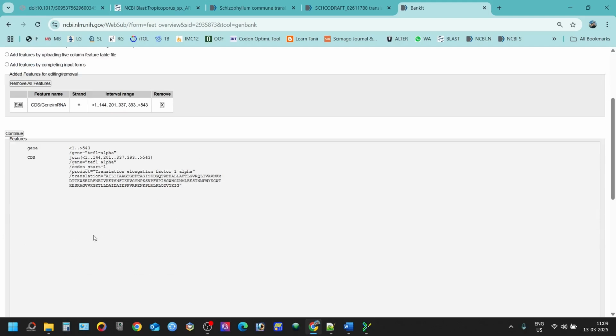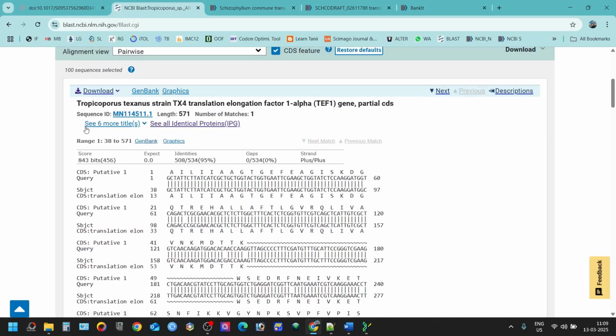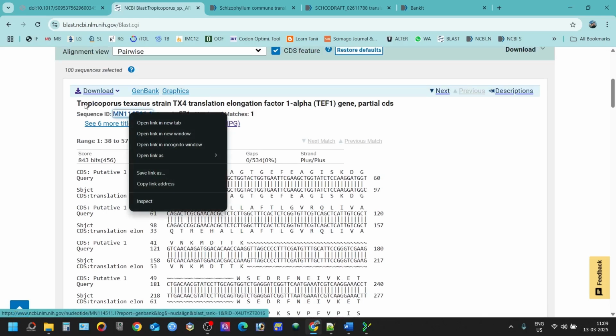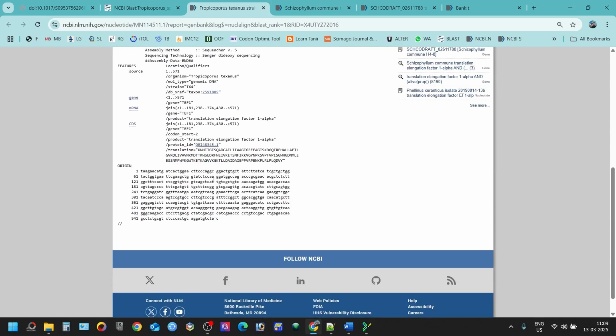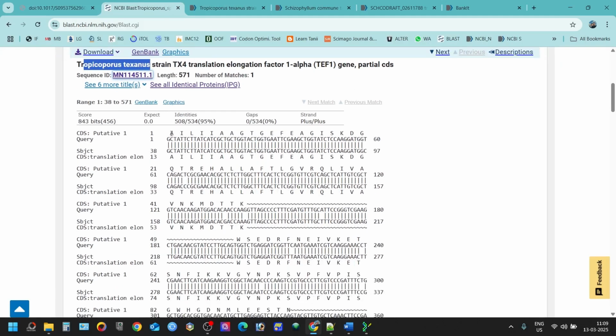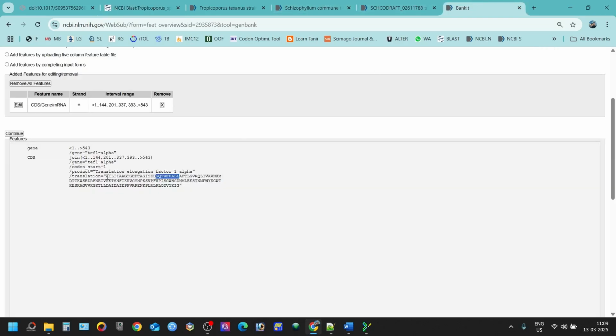And you can see, but don't just continue right now. You also have to copy some of the sequence from here and open the sequence which you have used for analysis. For example, this is the Tropicoporus texanus. Open it, and you will find that there are also some amino acid sequences here. If you search it here, then it should match, because most of the sequences were matching from here to here. This is to make sure that you're using the correct open reading frame.